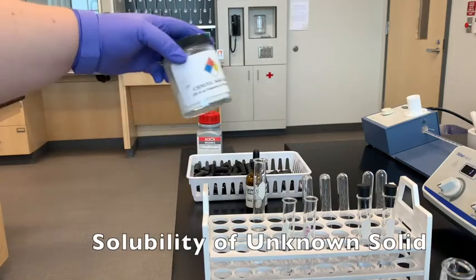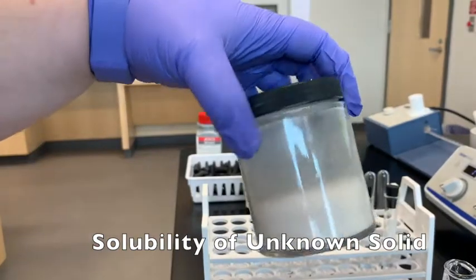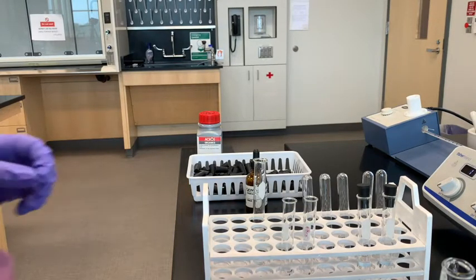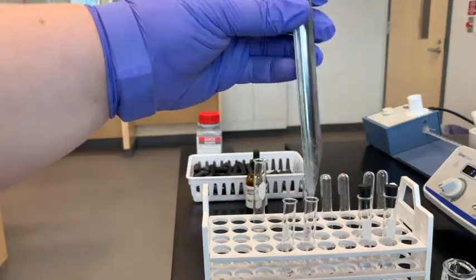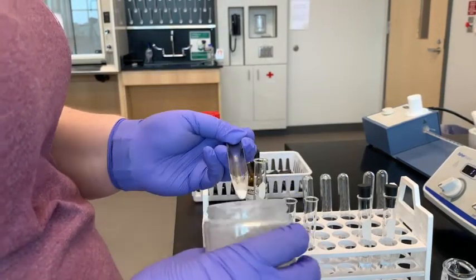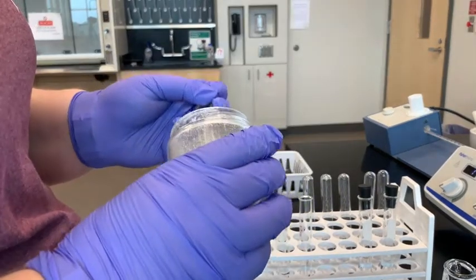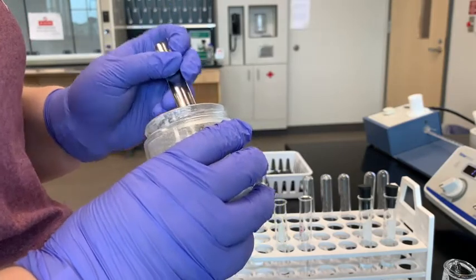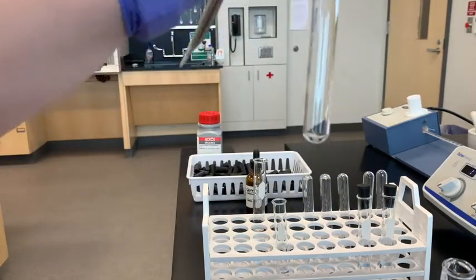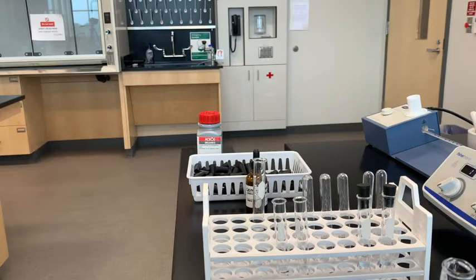We're going to move on to the solubility of the unknown solid. This is what the solid looks like — it's a white powdery substance. I'm going to put a little bit of this unknown into test tubes using a spatula, just a couple of pieces. Then we're going to test the solubility of the unknown solid with ethanol and water. The solubility with cyclohexane will be given on your report sheet or in the PowerPoint. I'll do ethanol first.